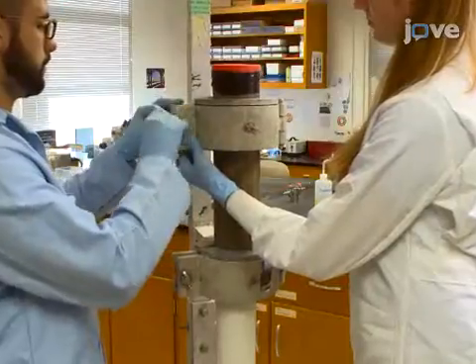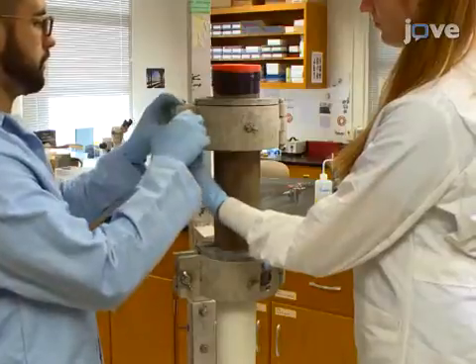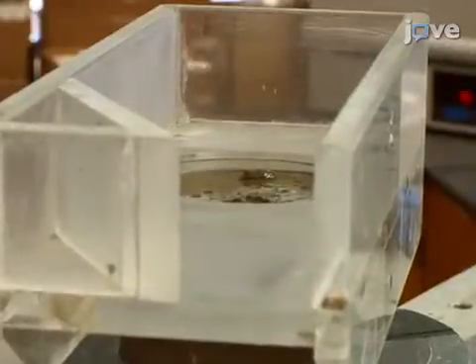After watching this video, you should have a good understanding of how to extrude aquatic sediment cores at millimeter resolution. Once mastered, this technique can be done in about two to four hours, depending on the sampling resolution and the length of the core.